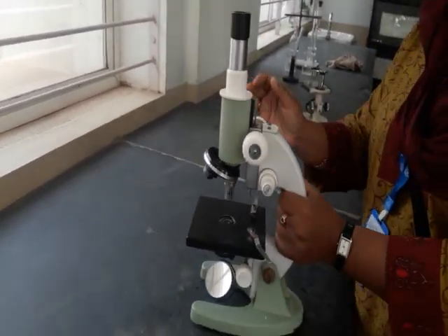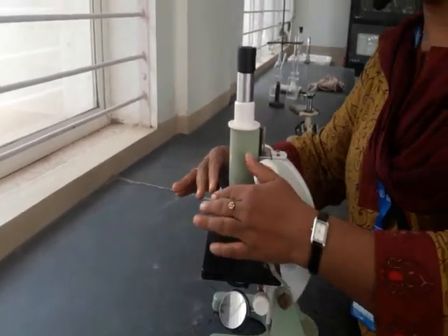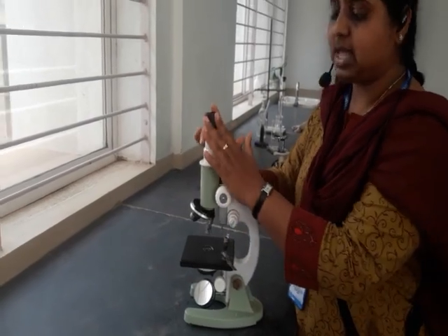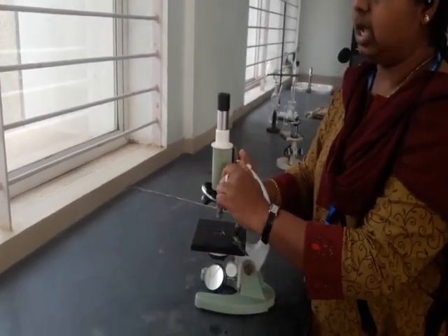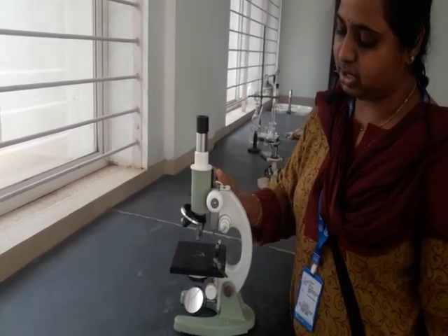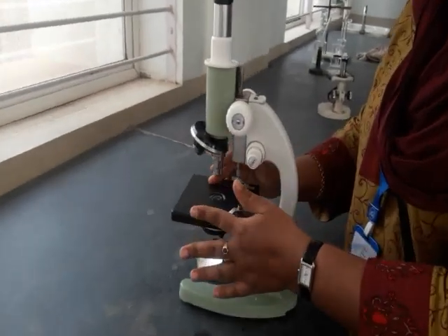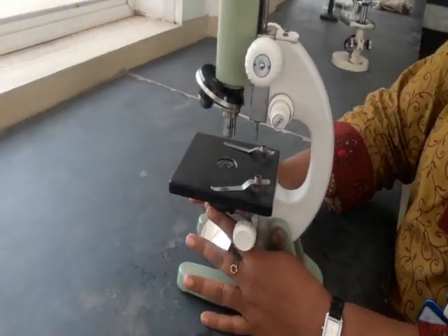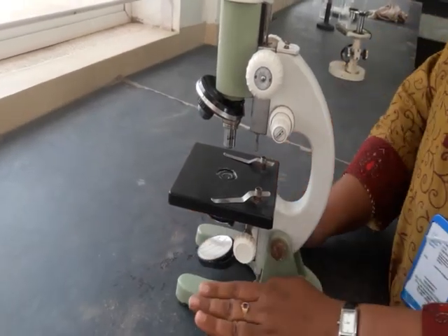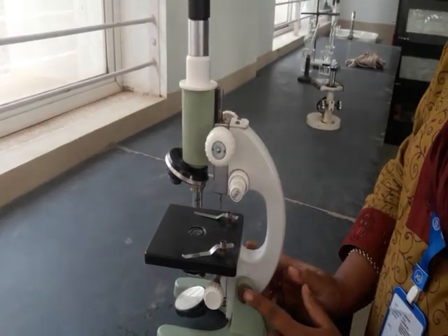This is the compound microscope. You can find there is a nose piece, a tube, objectives, and the eye piece. This is the rough adjustment knob — you can see I am able to adjust it. Then there is the fine adjustment knob. This is the stage, which is attached to clips. There is a condenser below, a concave mirror, the foot of the microscope, and the inclination joint.